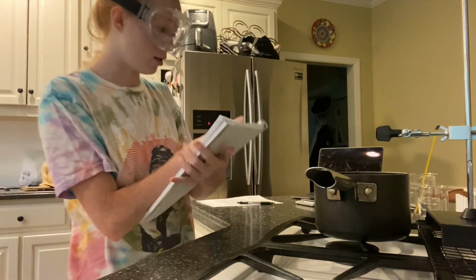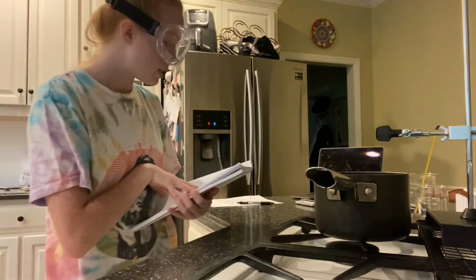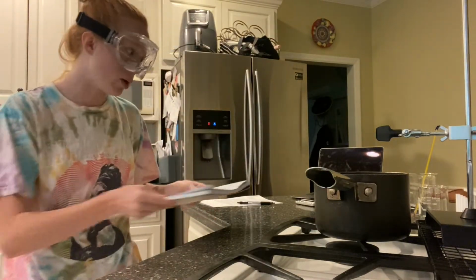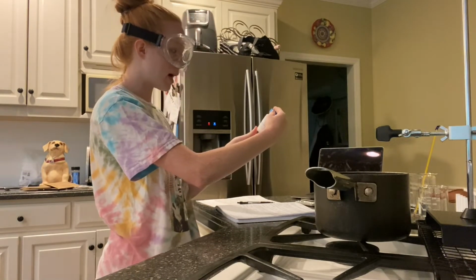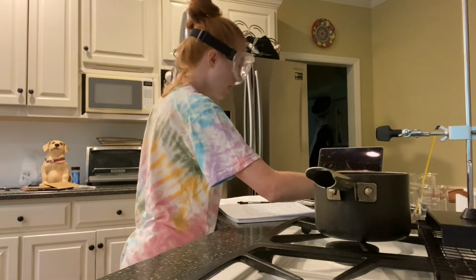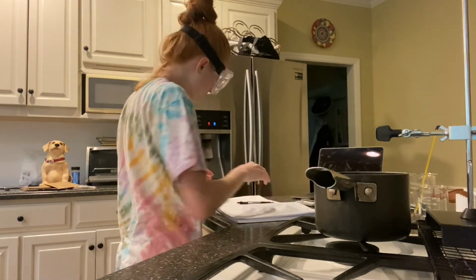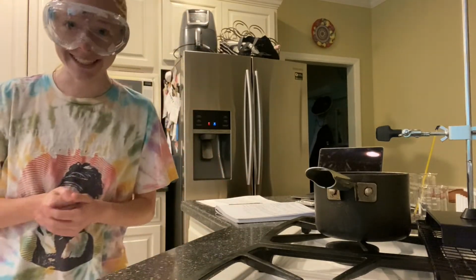So it's important to note, here's my pre-lab that I've done. I have included my purpose, my SDS, my references, and my pre-lab questions. Today we will be working with paradichlorobenzene as well as naphthalene, excuse me.